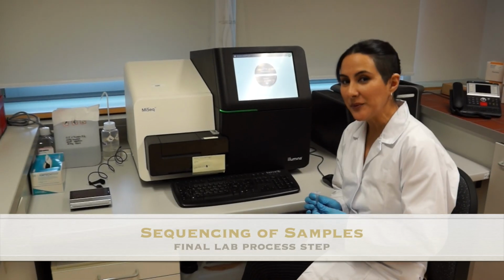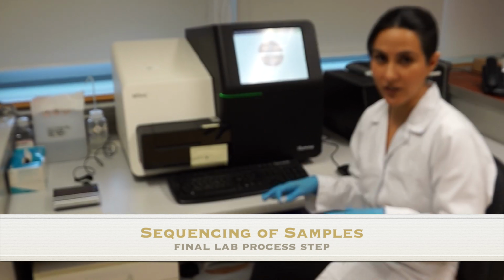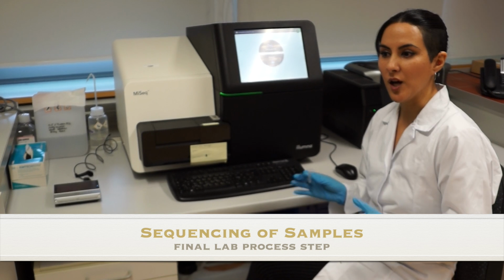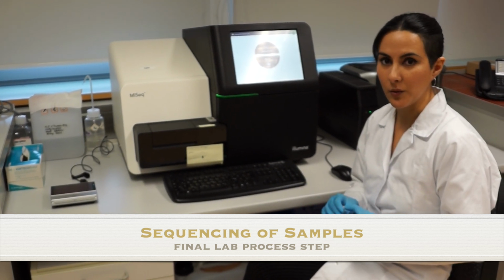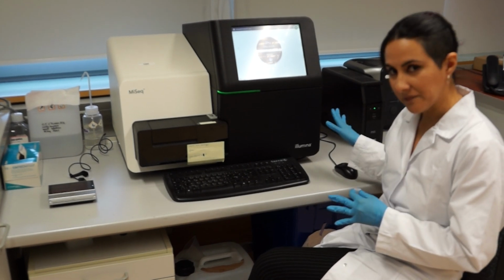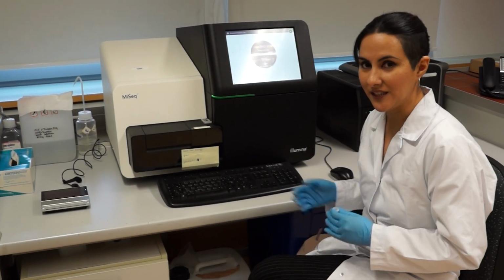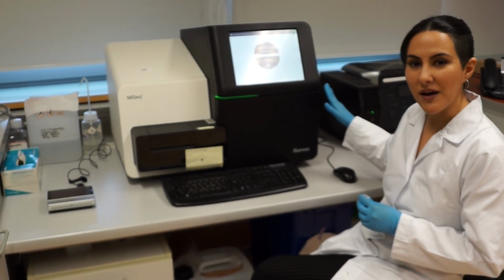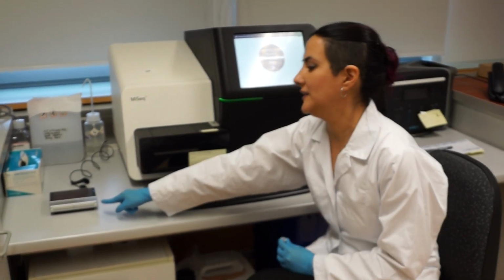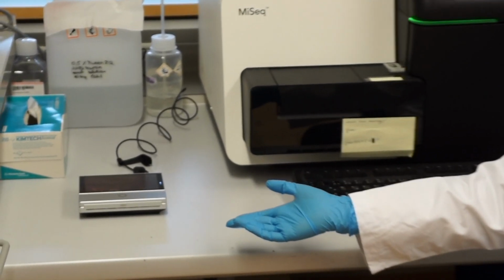So here we are almost in the last part of the work that we do inside of our labs. Here in Helmholtz Center, we have several options for doing the sequencing of our samples. In this case, we are seeing two machines, very different in size and the technology that they apply. So here we have an Illumina MiSeq for short read sequencing, and here the small one is a Nanopore. You can see the big difference in the size.